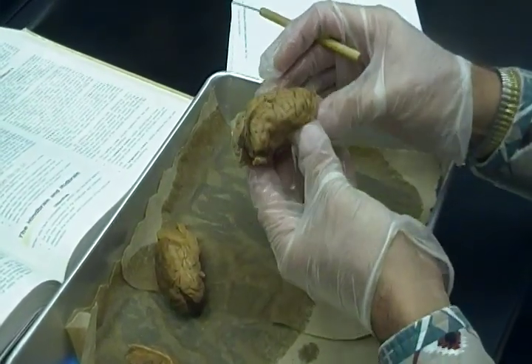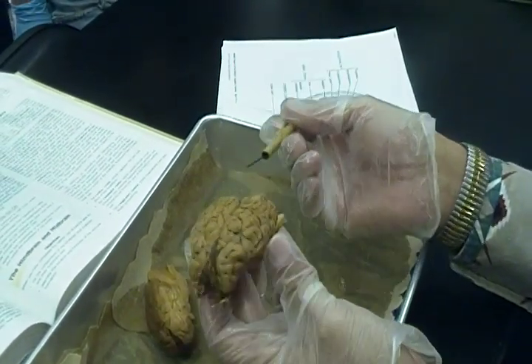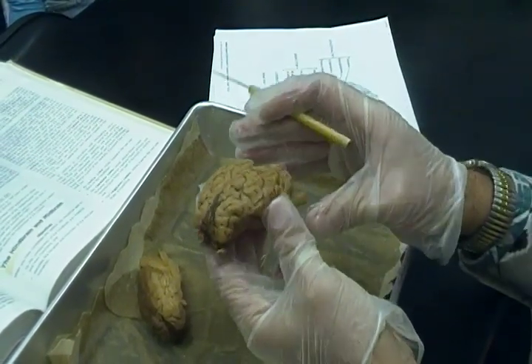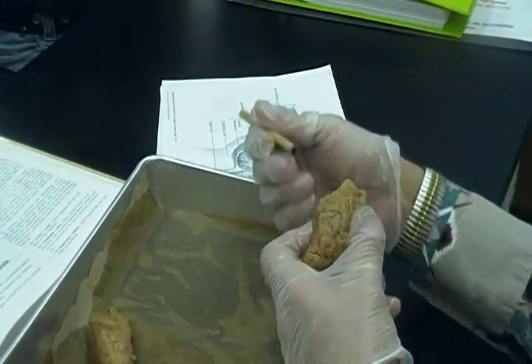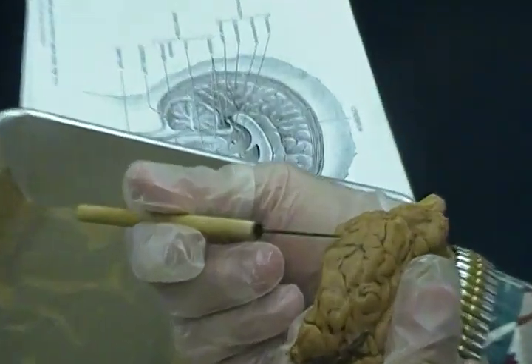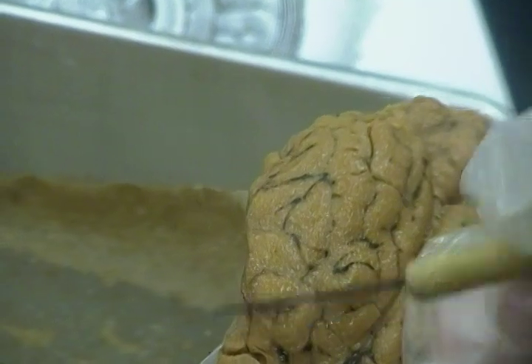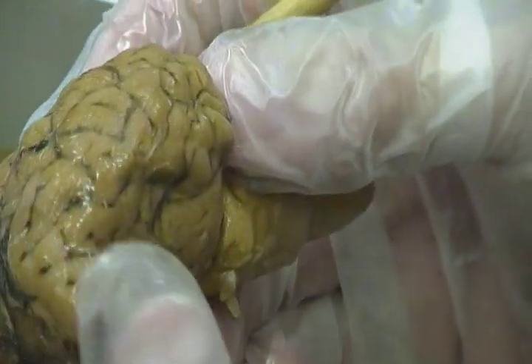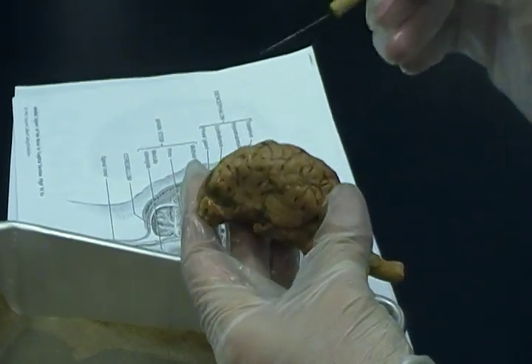Okay, no big deal. What lobe is this going to be over here? Frontal. It's going to be the front. What lobe is this going to be back here? Occipital. Now, this isn't exactly human, right? So things are going to be off a little bit. You can see a little depression right here. Any guess? Central sulcus. Which means this has to be what lobe? Frontal, which means this has to be? Parietal. Okay. Temporal, there's really not a whole lot to see over here, but there it's going to be.